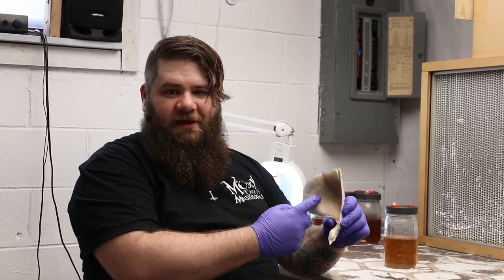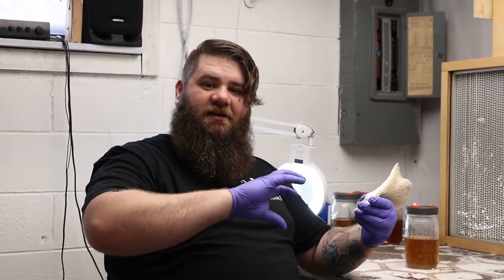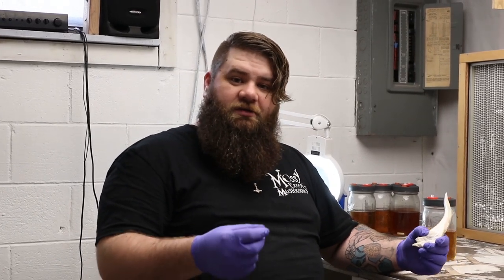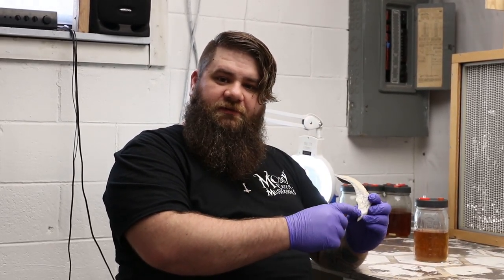I've seen a lot of people suggest that they can alcohol swab down an area and then stab through the side of a mushroom. You probably can do that, but alcohol is just a sanitizing agent — it is not a sterilizing agent, which means it doesn't get everything as clean as pure sterilization would. So I don't like to risk it. I prefer to split my mushroom open just like I would when taking a sample with a scalpel. You could do this with a scalpel straight to liquid culture, but it can be a little fussy getting your lids on and off. If you're working in your kitchen or even in the field, you can still do this tissue clone right in the jar with the needle. I suggest splitting your mushroom open instead of going through the side wall so you can keep it even cleaner.